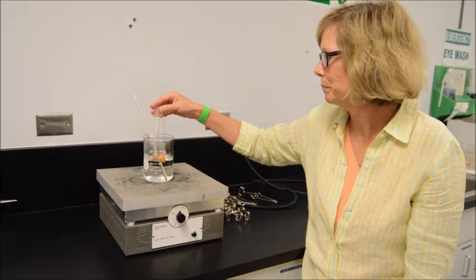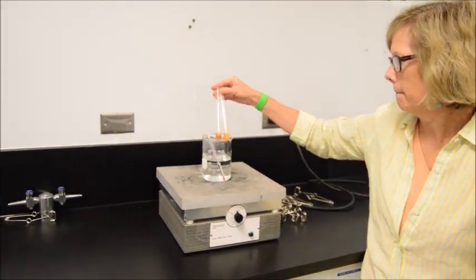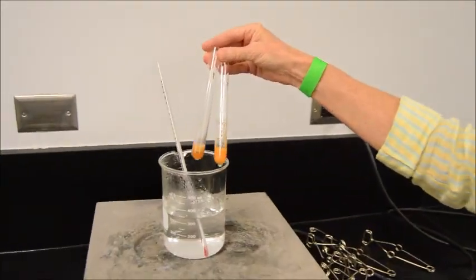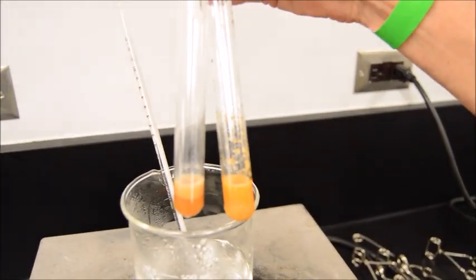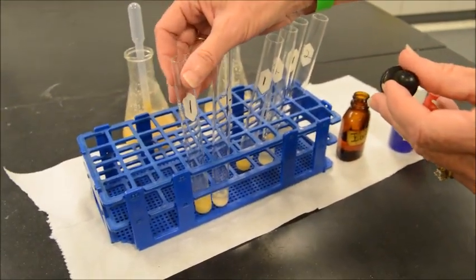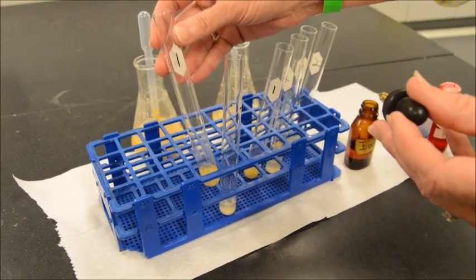All right. And again, here we're looking at simple sugars. Yes, Benedict's test. They are both positive, but from my perspective, the second one is a little more intensive than the first. Absolutely. All right, so we're set for the iodine test for starch and complex polysaccharides, and we're going to add 10 drops.